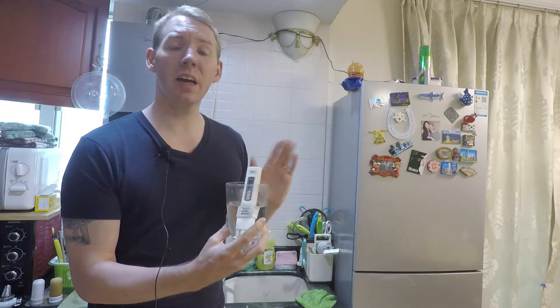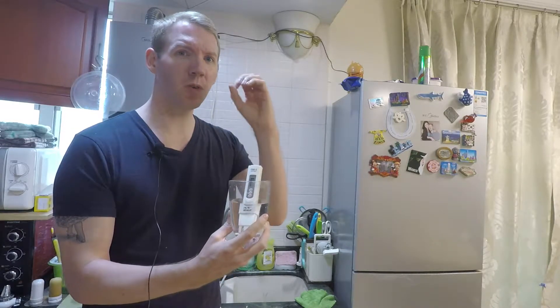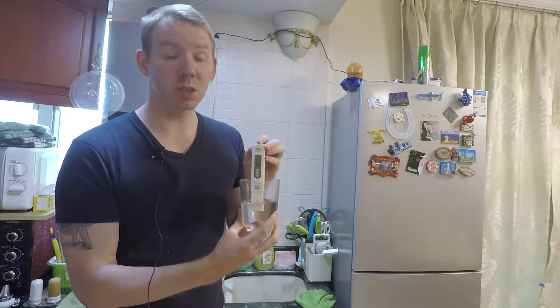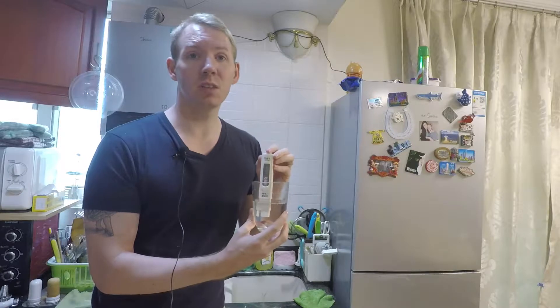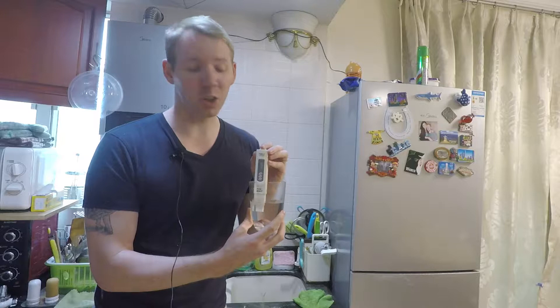So it's in the good range, but ideally we're looking for zero, because the thing is we don't know what these PPM particles are in this water — the contaminants. It could be that it's from minerals like in spring water, or it could be urban runoff. We're not quite sure.